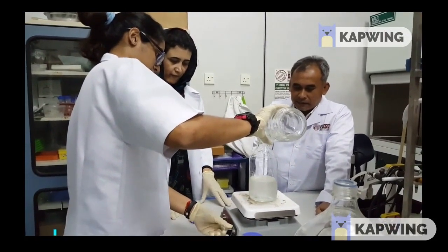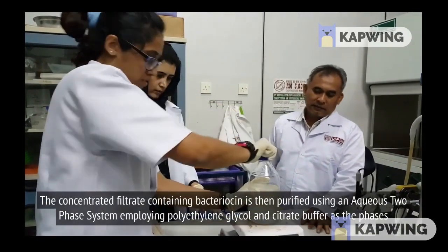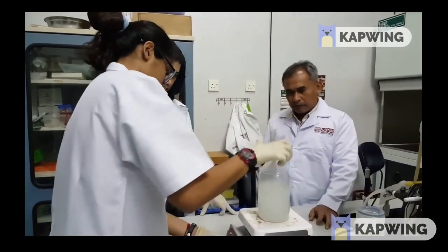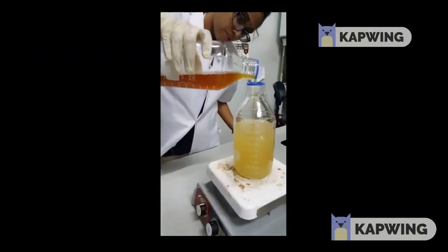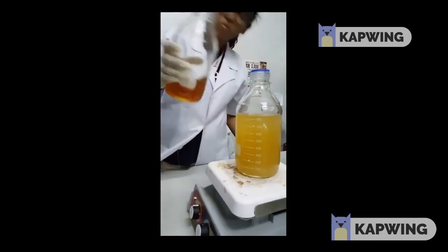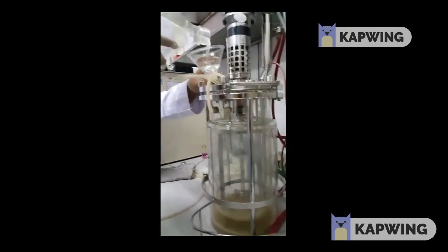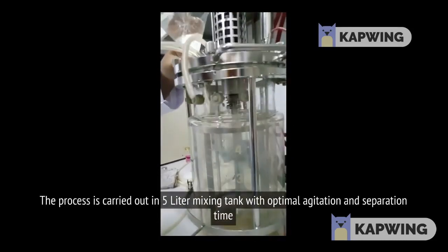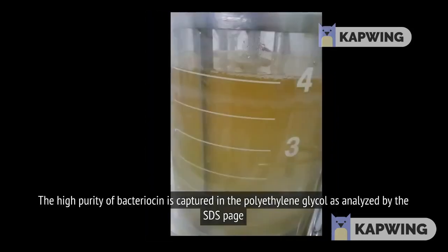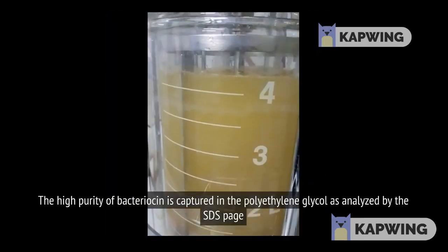The concentrated filtrate containing bacteriocin is purified using an aqueous two-phase system, employing polyethylene glycol and citrate buffer as phases. The process is carried out in a 5-liter mixing tank with optimal agitation and separation time. The high-purity bacteriocin is captured in the polyethylene glycol phase, as analyzed by SDS-PAGE.